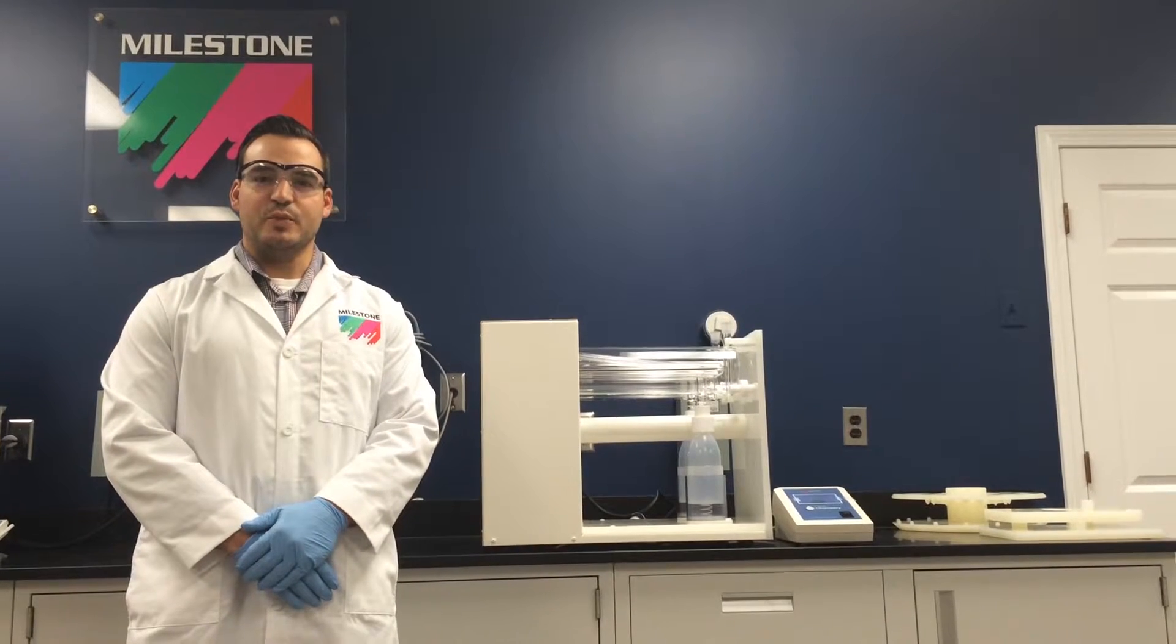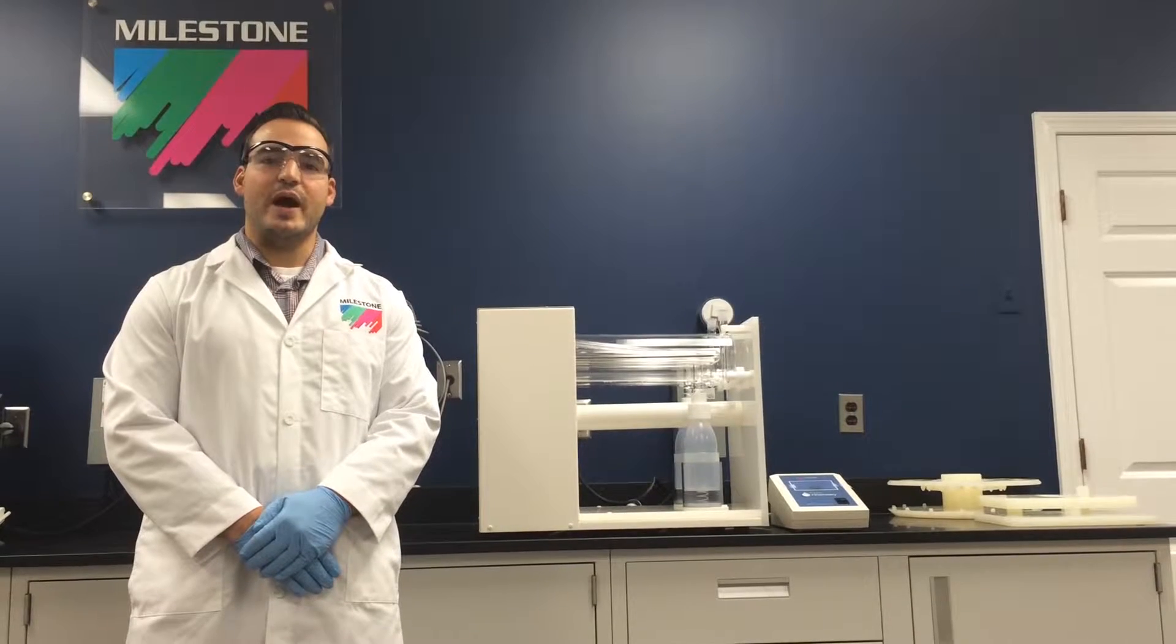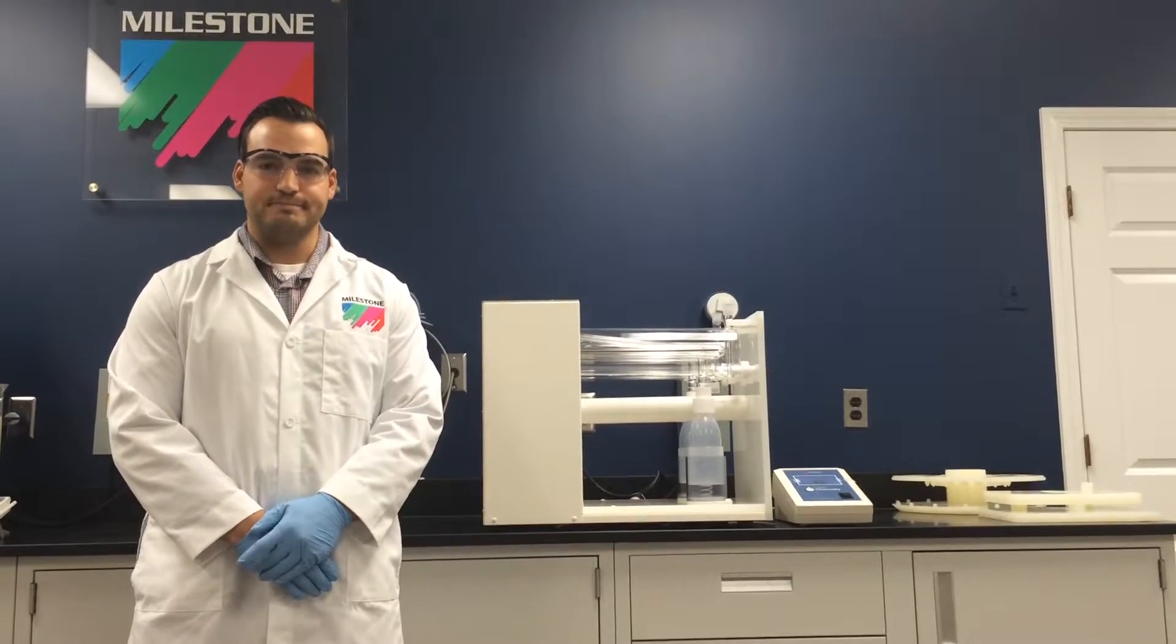Hi, my name is Jason Gervino. I'm an applications chemist with Milestone and this video will show you how to use the Milestone DuoPure.